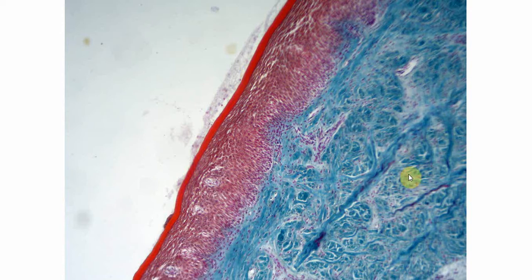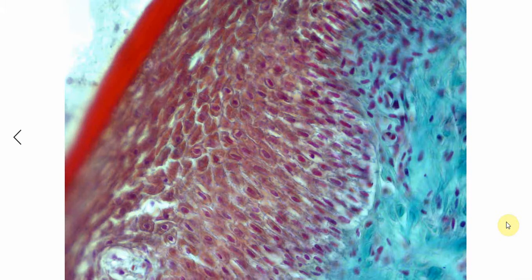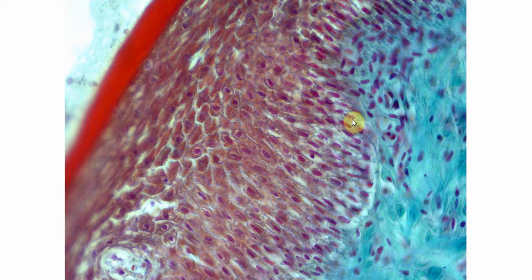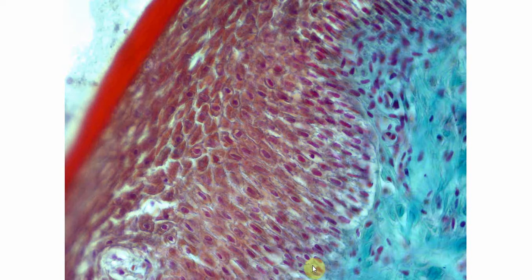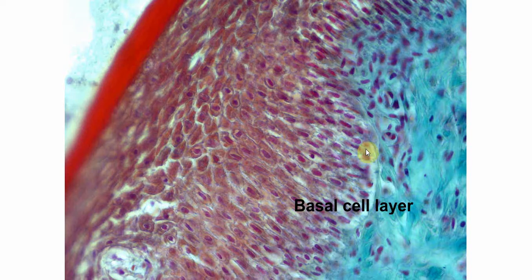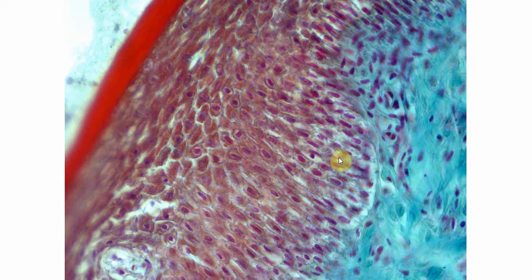Now let's see the high magnification image of the same slide. These cells that are just adjacent to the basement membrane are the basal cell layer. These cells have a cuboidal shape, and the cuboidal cell layer is 2 to 3 cell layers thick.